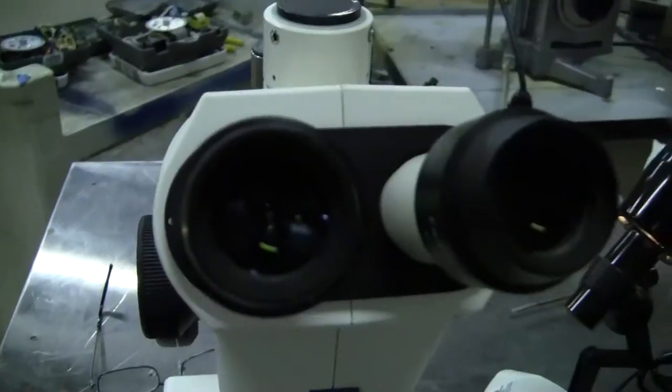I'm going to do some adjustments here. Zooming in, zooming out. That's what I was just looking into — that's a beautiful way of doing it. I can do it again on this side. There we go.